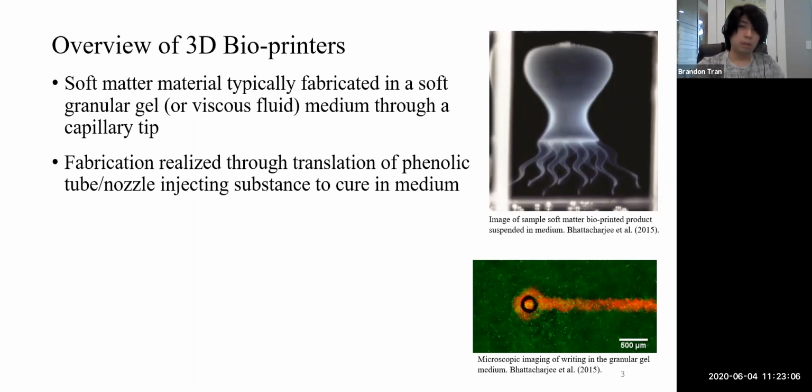Injection of substance. Okay, so that's basically the same sentence. I think all that adds is that we basically put the nozzle inside of the medium and then print out the structure. I have this video on the bottom here. It shows the 3D printing process happening within the medium, and how the trail of the substance is left behind within the medium. You can see it's similar to a wake in fluids, where you have the distribution of airflow about your subject. There are some other interesting things that go into that.